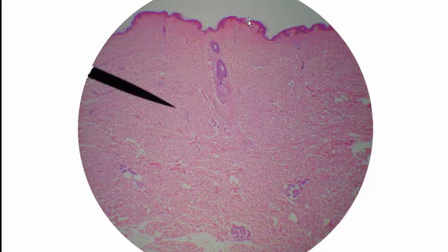So again, the three major layers of skin in thin skin, we have epidermis on the top, dermis in this neighborhood here, and then hypodermis down below. There are also some accessory structures that we could point to in this image. These two purple circles are hair follicles, and at higher magnification you'd be able to see the hair shaft inside of the hair follicle. And then this structure below those two hair follicles is a sebaceous gland. And then down here we have a sweat gland, eccrine sweat gland.